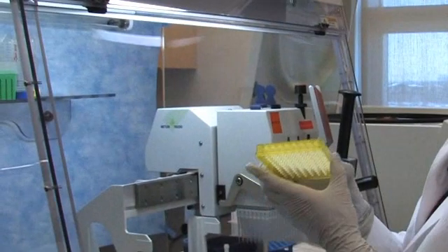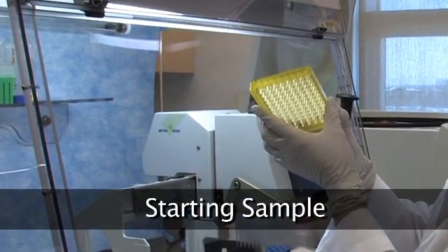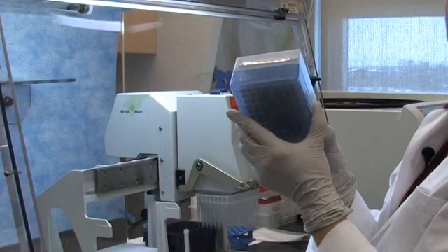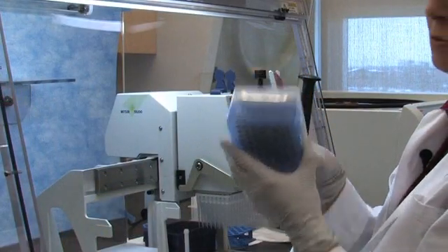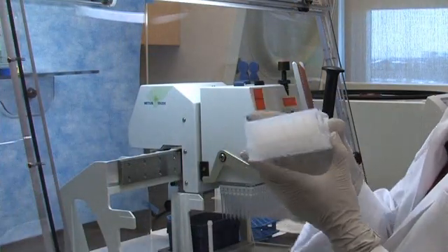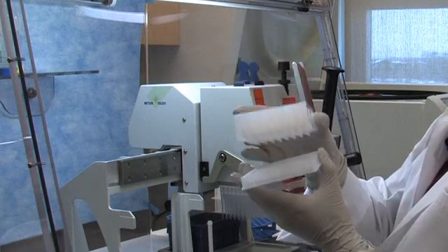Here we have the plate with 350 microliters of plant lysate that was just spun on the centrifuge, a plate containing 100 microliters of plant binding buffer, and a glass fiber plate with a 1 micron glass membrane that DNA will bind to during the DNA extraction process.